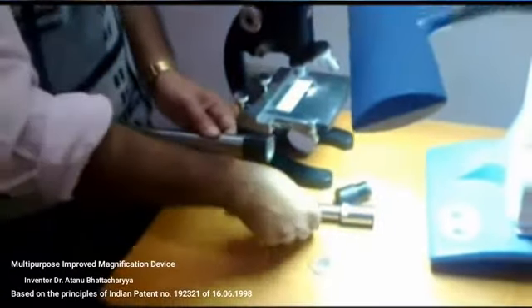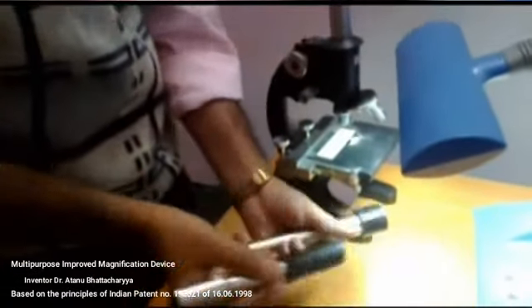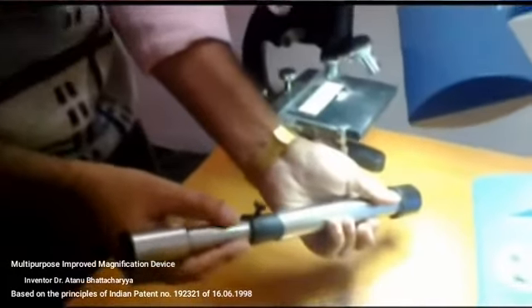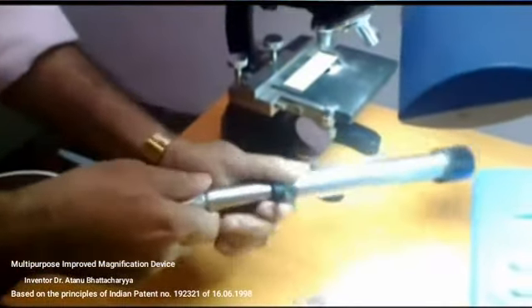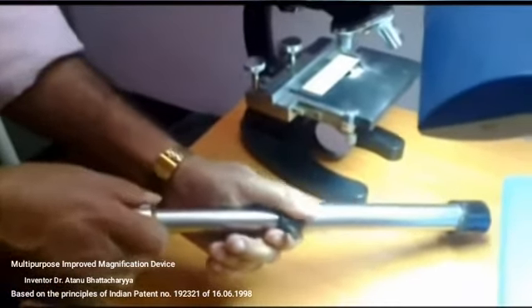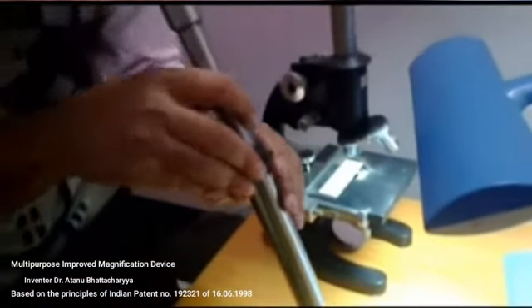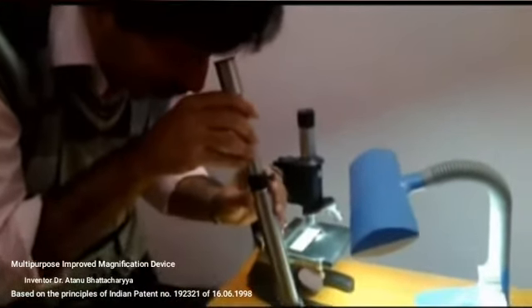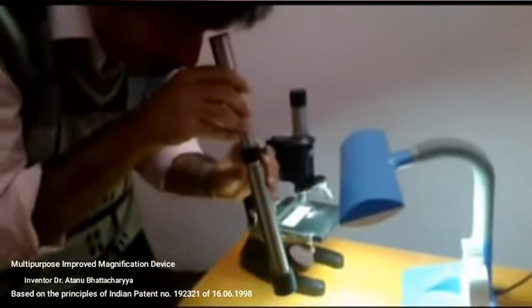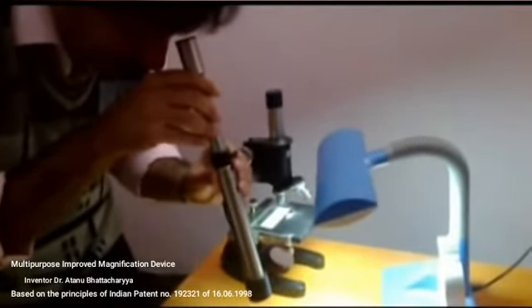For the field microscopic view, I have to insert this device into the T3 tube. Now I am inserting the tube. I have inserted it. For field microscopic view, I have to pull the T1 tube much. Then any object can be seen. Just keeping my eye on the eyepiece, and by moving upward and downward to a certain position, the image can be seen very clearly. Actually 30, 40, even 50 times magnified image can be seen here. Here the fibers of the table are being seen very clearly.